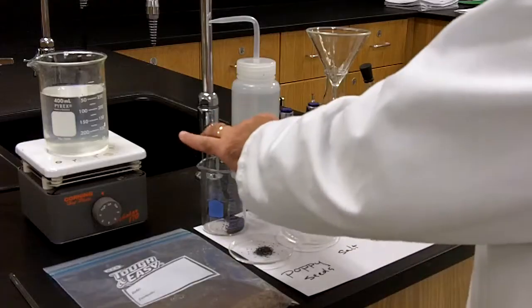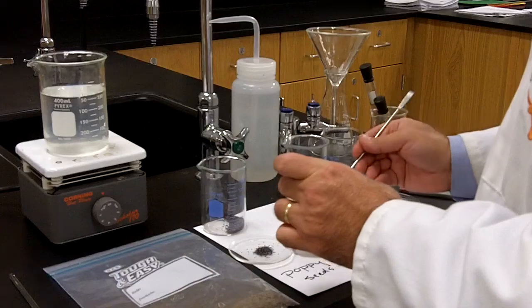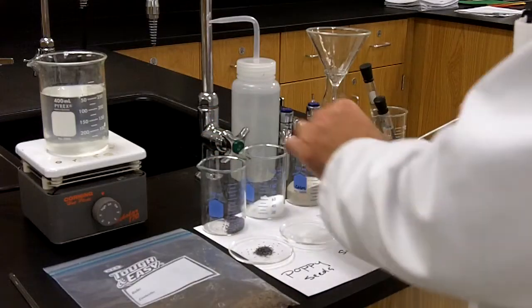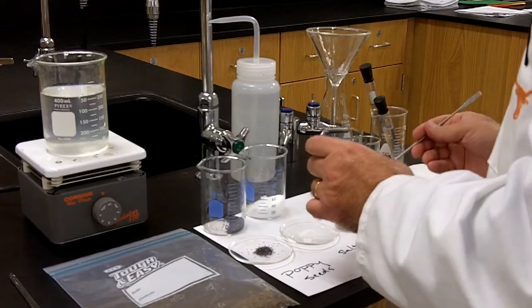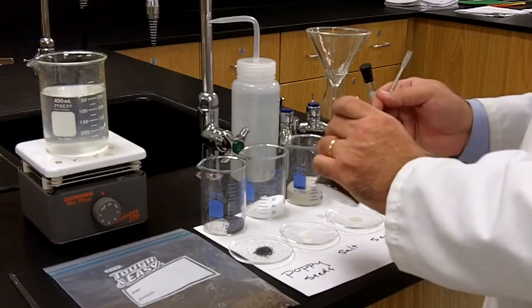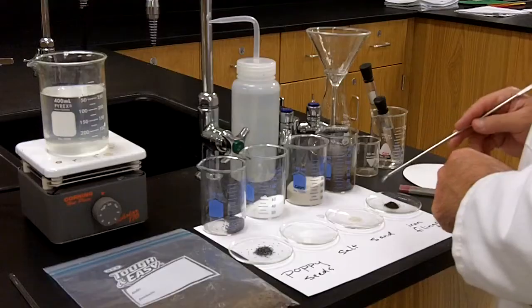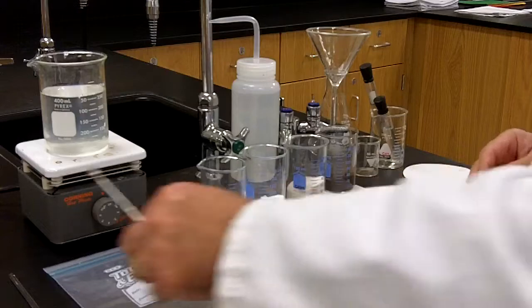The second is salt, just regular table salt that you might have in a salt dispenser on your kitchen table. And you've seen salt already when we talked about the homogeneous mixture. The next is sand. This is silicon dioxide that you see on any beach. Silicon dioxide has specific properties that we'll talk about. And the last one is iron filings. This is just industrial grade iron, and it's been filed down, so it's very small. So these are the four substances: poppy seeds, salt, sand, and iron filings contained in the bag.